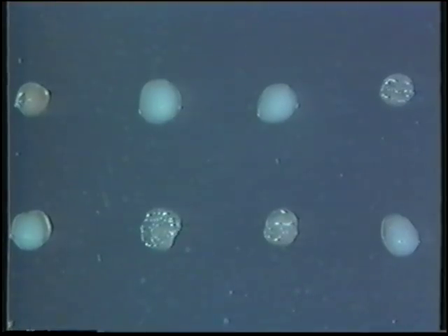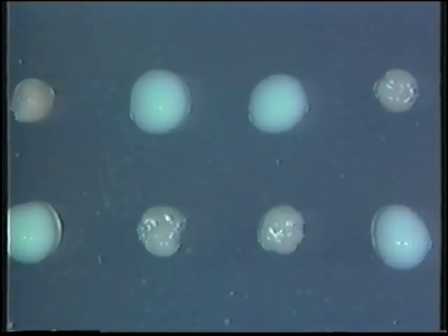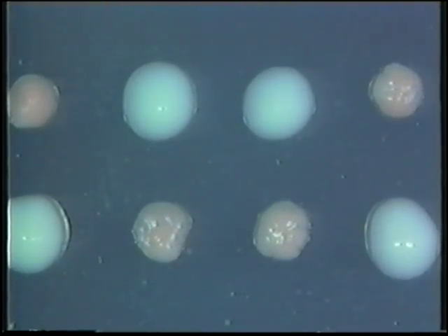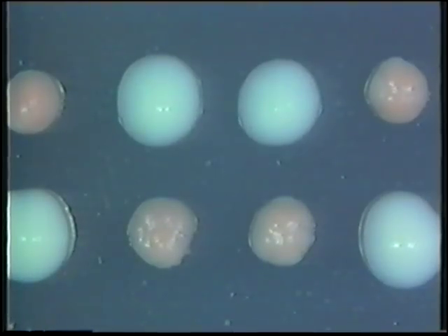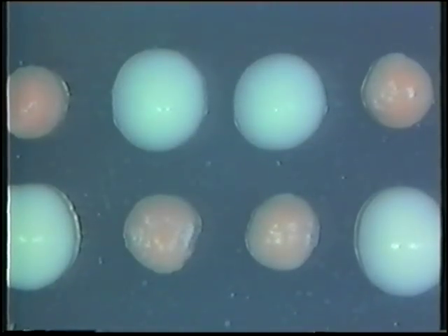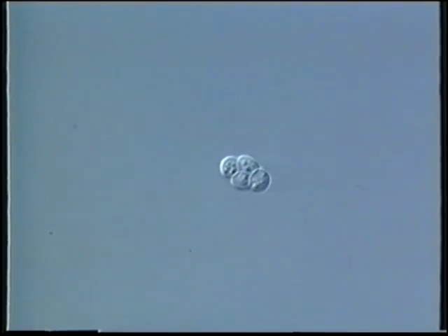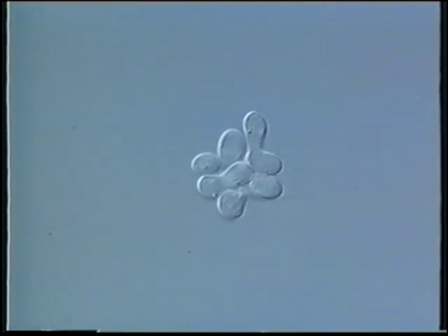With the help of a micromanipulator, the ascospores are distributed at will on a solid medium and allowed to form separate colonies. Tetrad analysis is the genetic study of the four clones produced by each ascus. It is a powerful tool of yeast genetics which finds no equivalent in higher plants and animals. The 2-2 distribution is characteristic of nuclear genes in heterozygous diploids. Here's the germination of an undisrupted ascus whose wall is breaking up. Contiguous cells of opposite sex fuse to form new diploid zygotes, resulting in a complex mixture of diploid and haploid cells of different genetic constitutions.